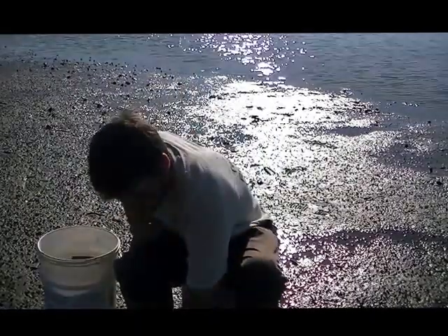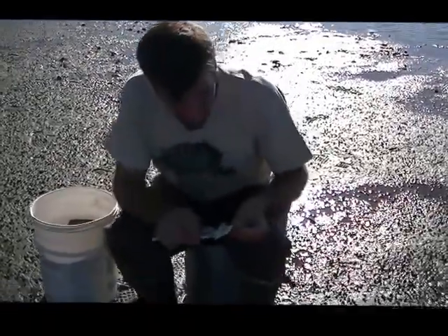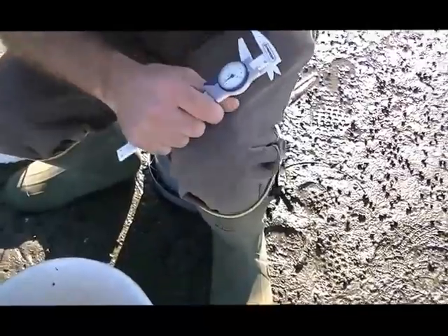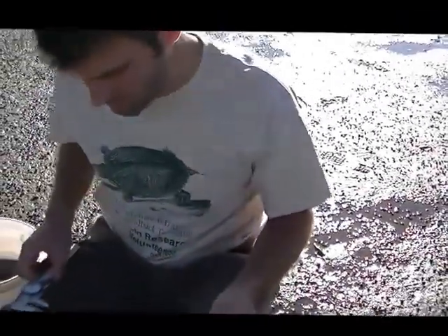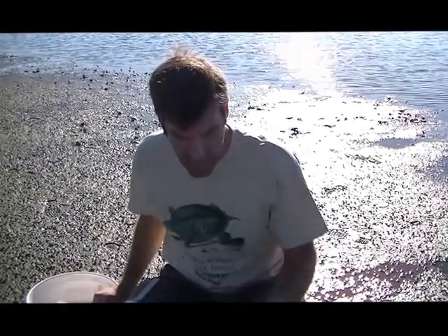You'll keep picking up the snails and measuring and go through your 100 snails. If you get through your 100 snails and do not find any of the parasites, the ideal situation is that you could do another collection, because to verify that they're truly not there, 100 isn't enough. But 100 is a good starting point for a project like this.